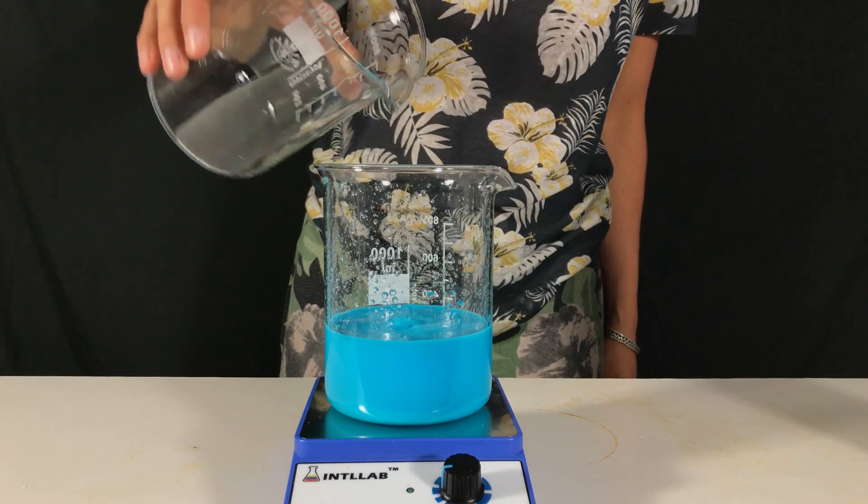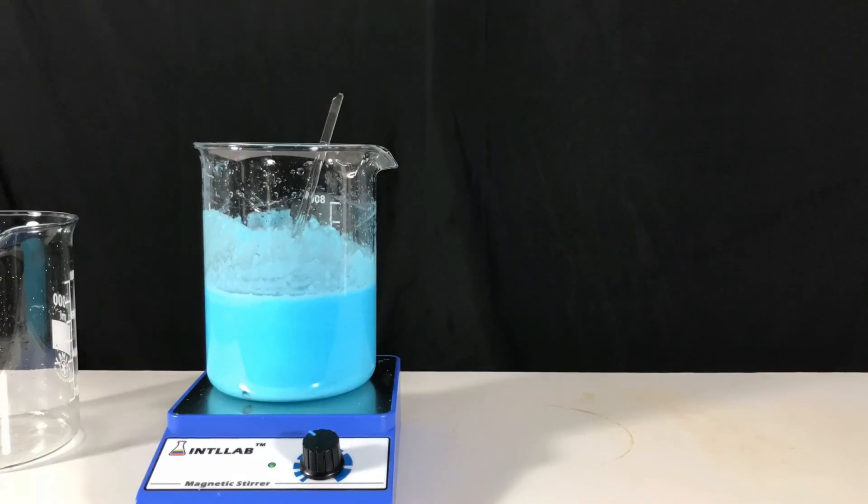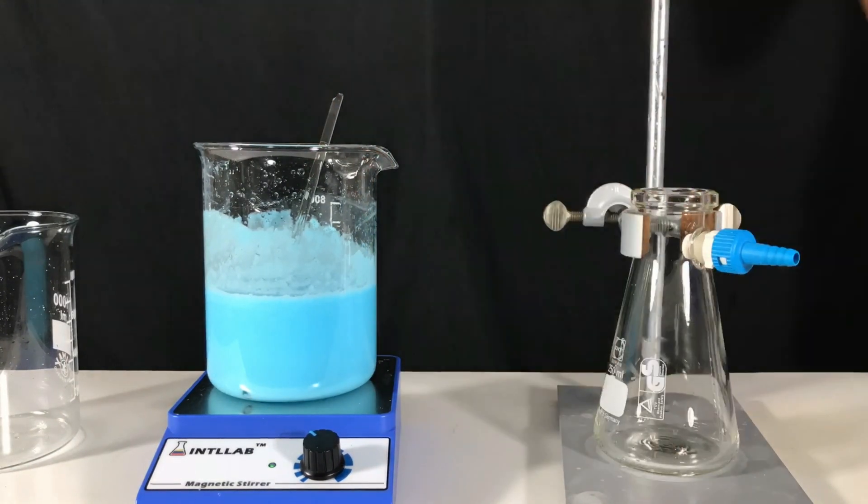Copper benzoate has a pale blue color. To make sure that the reaction is complete we let all of this mix for five more minutes.